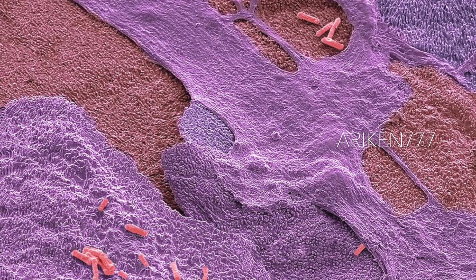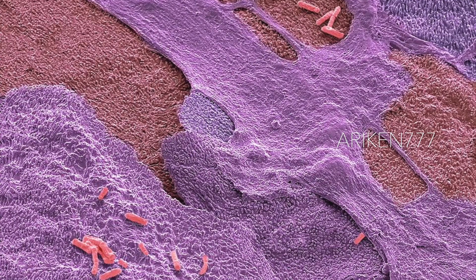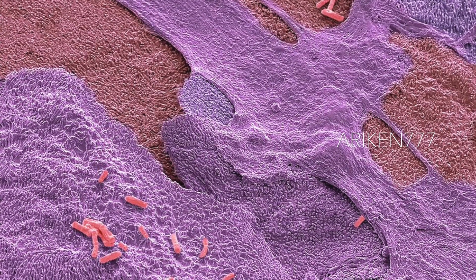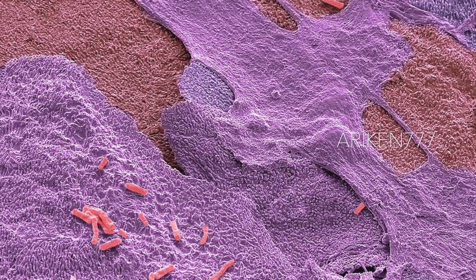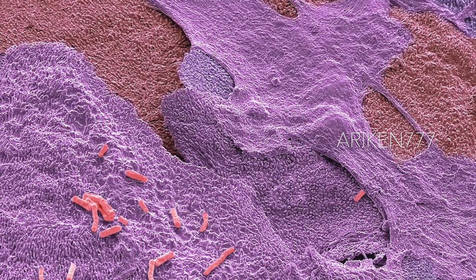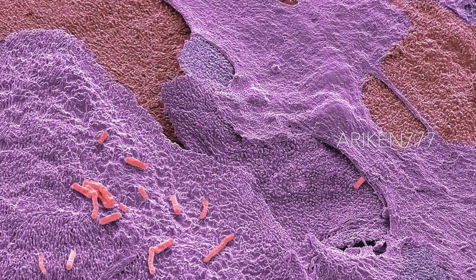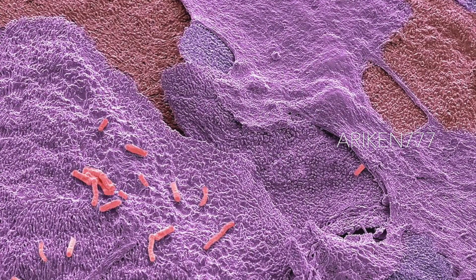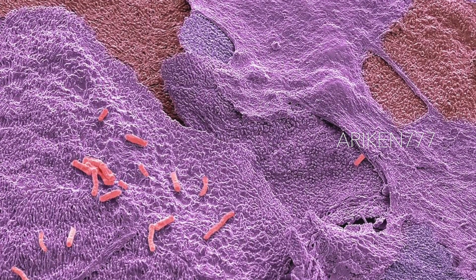These are E. coli rod-shaped bacteria on the bladder epithelial cells, found in a urine sample from a patient with a urinary tract infection. The urinary tract is usually sterile, so the presence of any microorganism is termed a urinary tract infection. The main cause of urinary tract infections is E. coli.